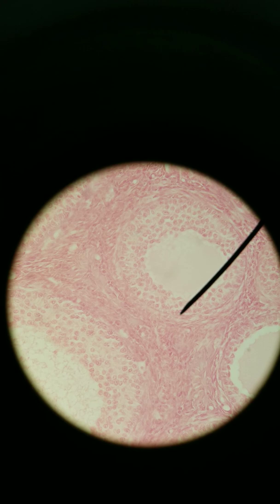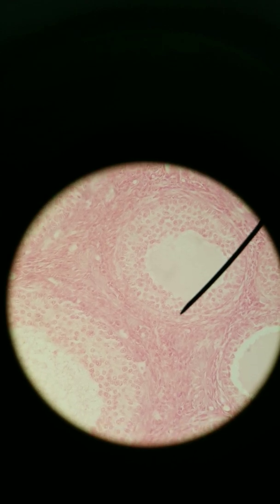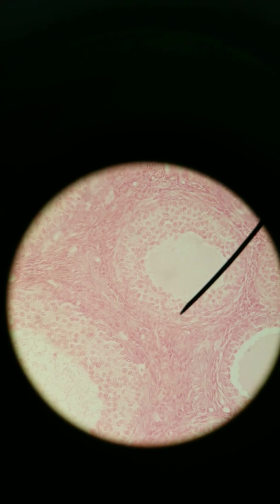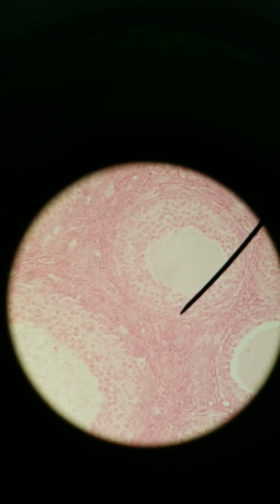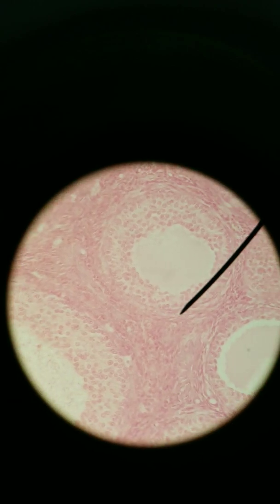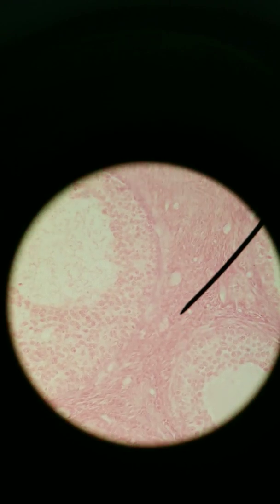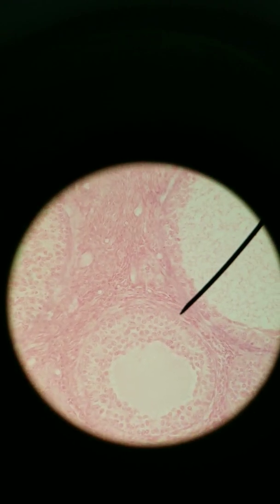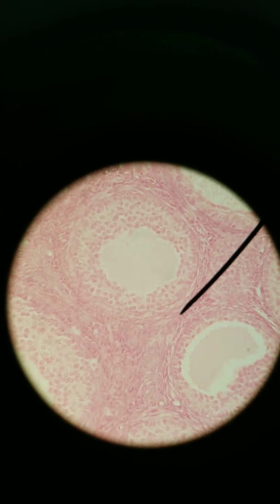And the granulosa cells, they release estradiol. Estradiol is a form of estrogen. So those are granulosa cells. If you look on the outermost portion of the follicle, you see these granulosa cells are pretty round and boxy. These cells here are flatter. These flatter cells that surround this follicle, these are called theca cells, theca cells.